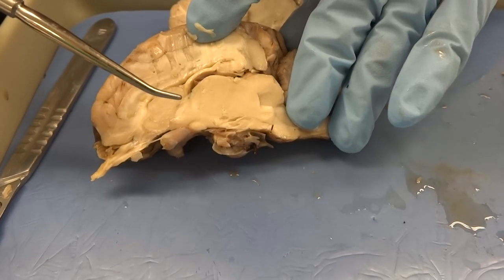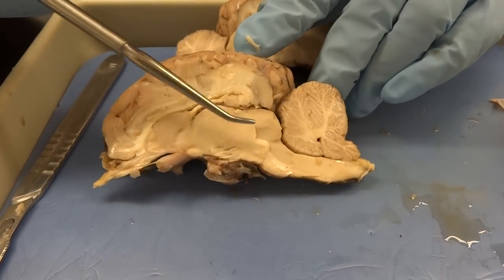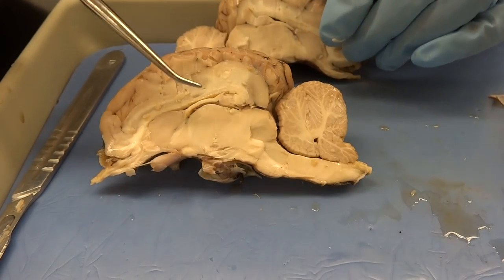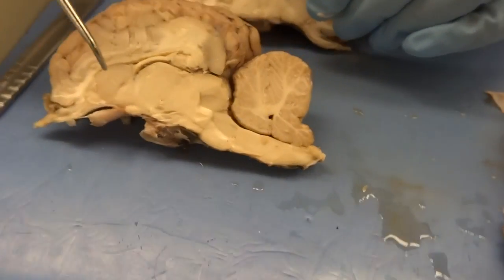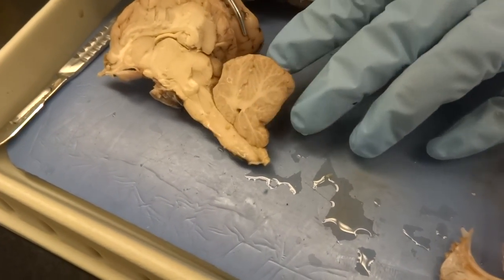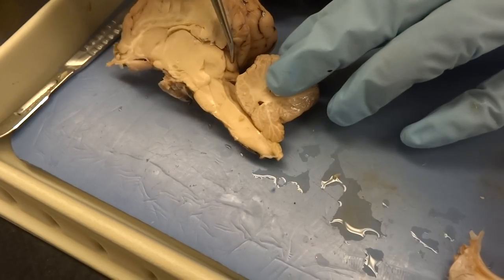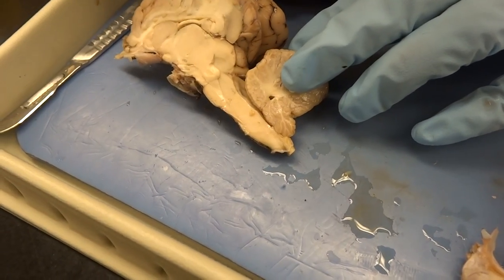We can also see our midbrain, which has two little bumps — from this angle you can see the bumps right at the back of the midbrain. Those are our corpora quadrigemina, the superior and inferior colliculi.